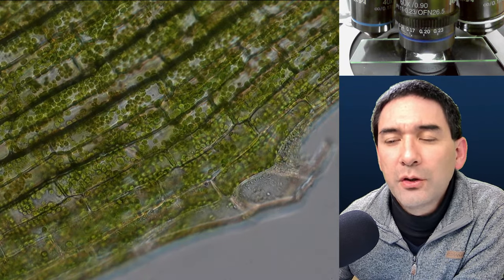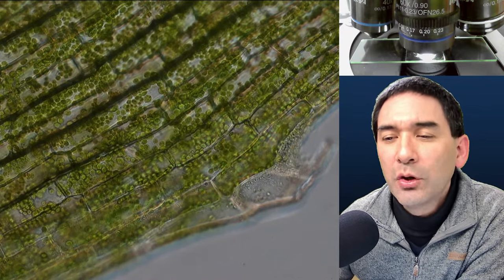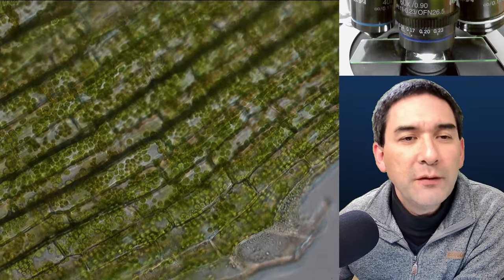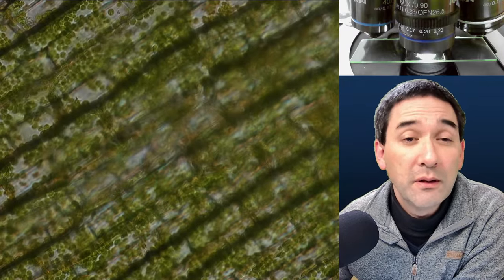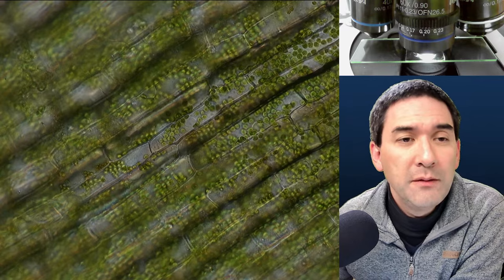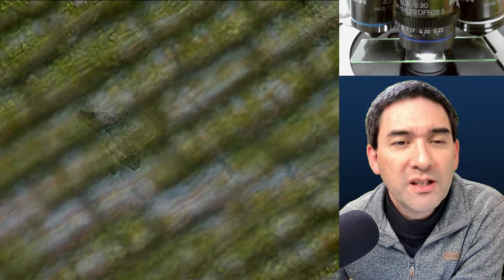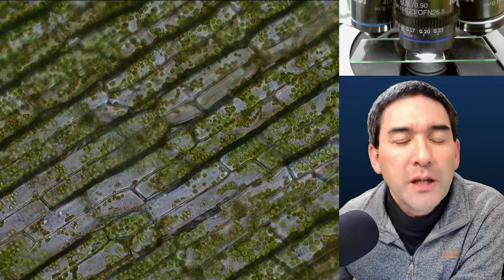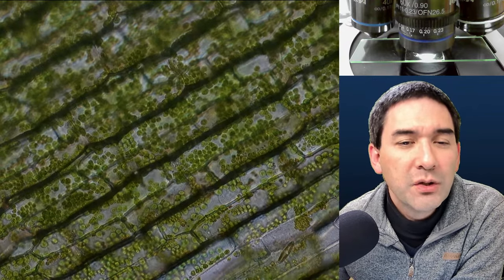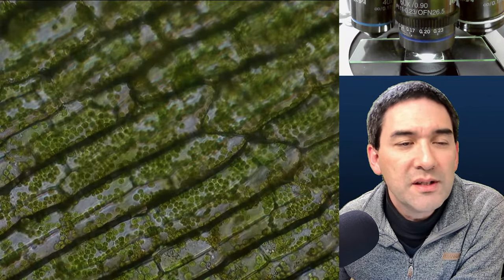There's a comment that the size of the Elodea chloroplasts and the diatom chloroplasts are not the same — that's correct, and they don't have to be. The size of chloroplasts can differ vastly. For example, the alga Spirogyra has a spiral-shaped chloroplast — a pretty large one. The size difference is not surprising.